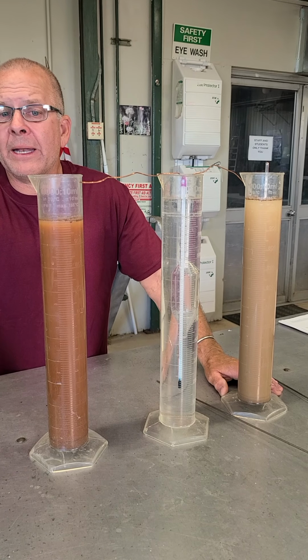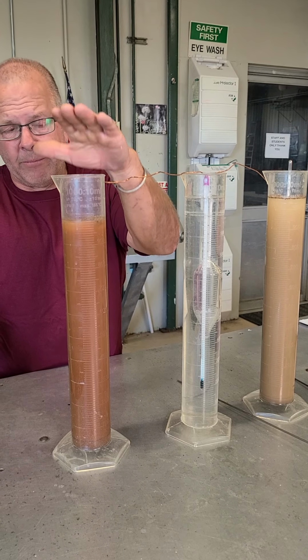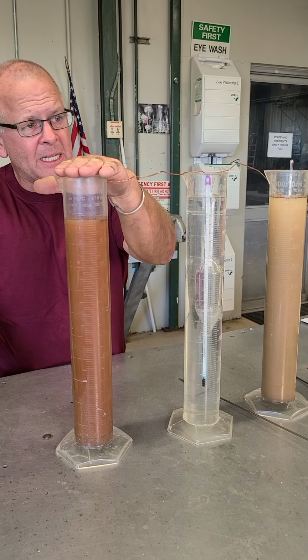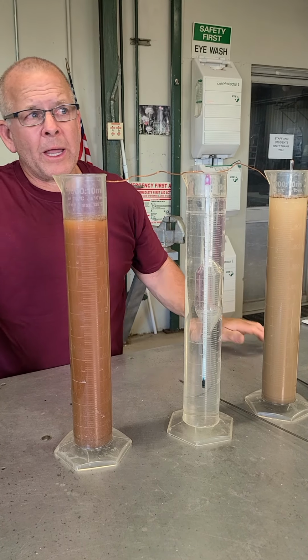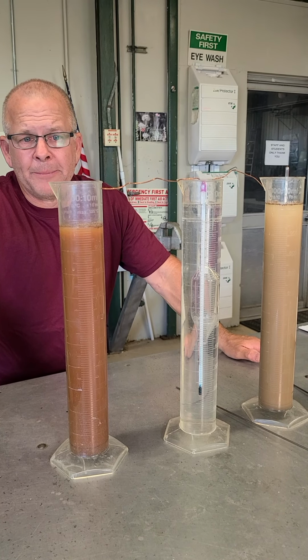So I'm going to go ahead and do this one, and we'll get this one going. I guess you don't need to see it, but I'll tell you what happens after the fact. And then we're going to wait our 3 hours, and we're going to see how the readings have actually changed. Okay?